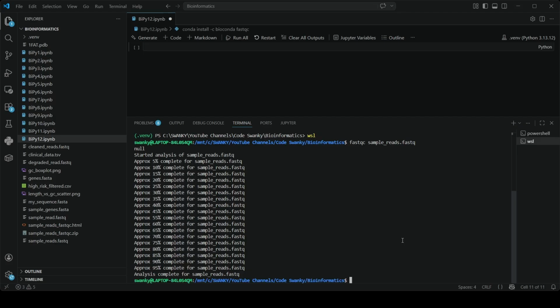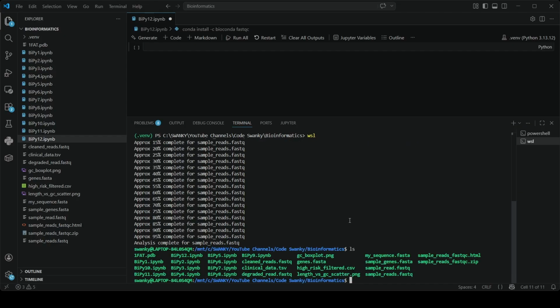As soon as you hit enter, you will see this text flashing on the screen as FastQC processes the files. It is analyzing the GC content, the sequence length, and the Phred quality scores for millions of bases in a matter of seconds. And when it is done, you can type ls to see what it has created. Since some files are already there, I will just point it out for you. The two new files that we got are this one HTML file and this one compressed file. So this HTML file is what we want.